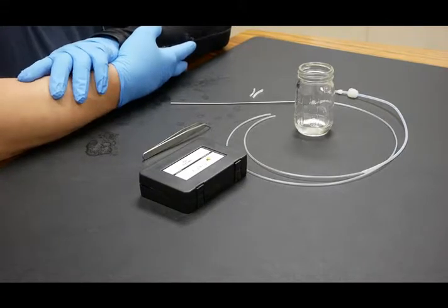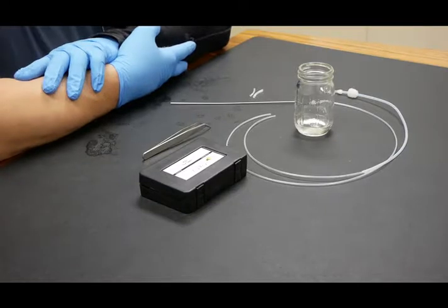Hello. Today we're going to show you how to tube the flow cell for the Autoturb 3. This is for the new style flow cell.